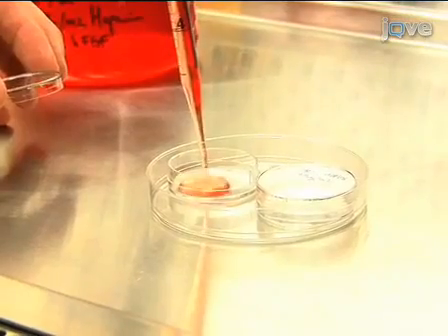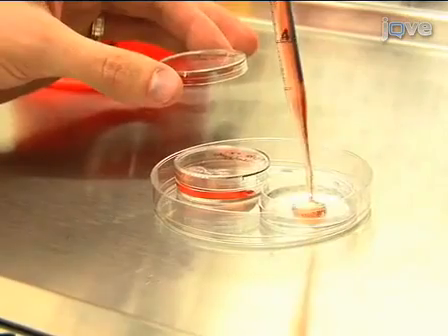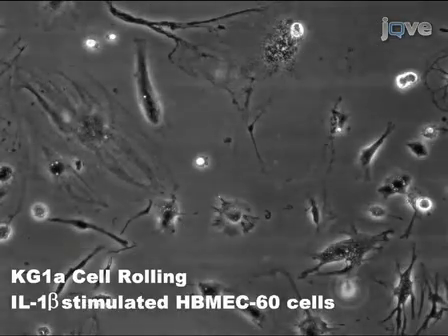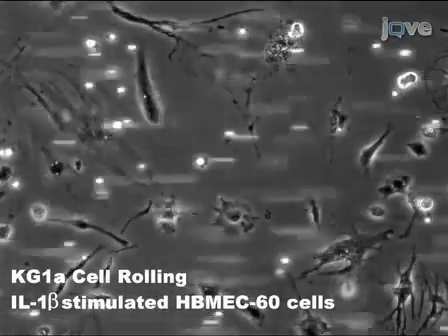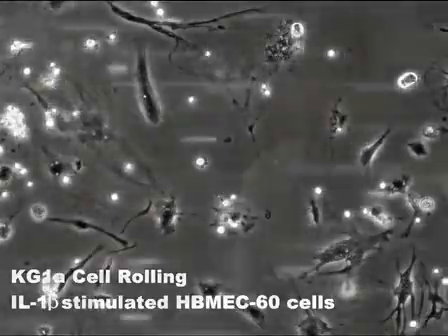Today we will show you a procedure for analyzing the role of E-Selectin and E-Selectin ligands in the adhesion of human leukocytes to human bone marrow endothelial cells under physiologic blood flow conditions. We use this procedure in our laboratory to study the role of cell surface molecules that initiate the adhesion of white blood cells or metastatic cancer cells to endothelial cells, which line the inner surface of blood vessels. This adhesive event is characterized by a rolling behavior like a bowling ball rolling down a lane. So let's get started.